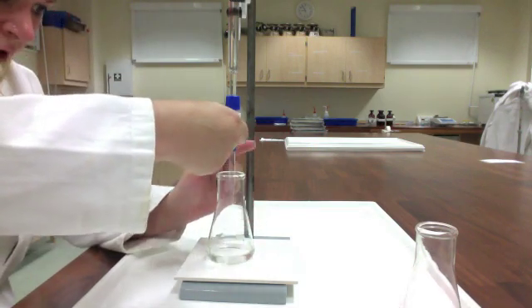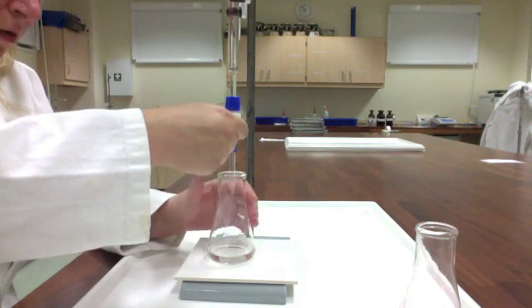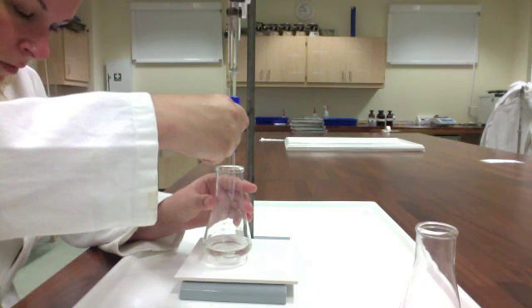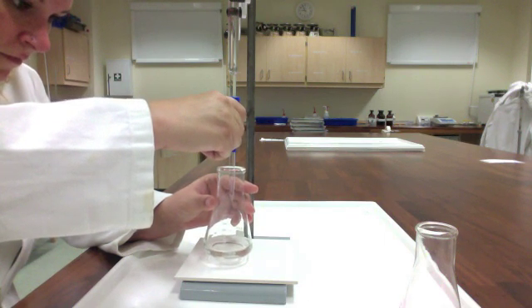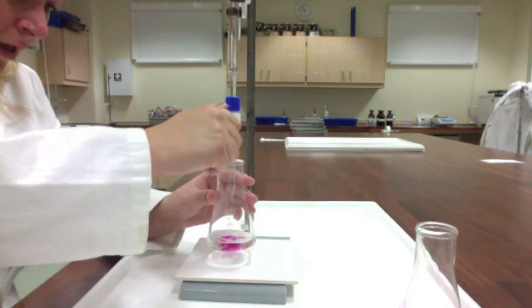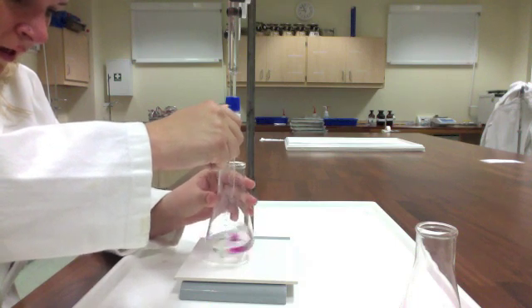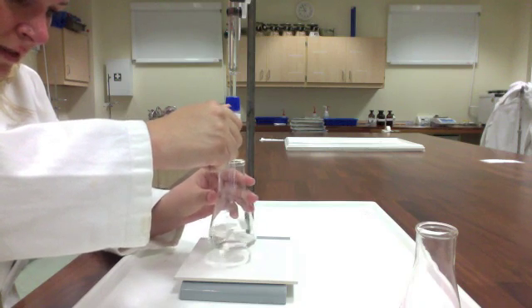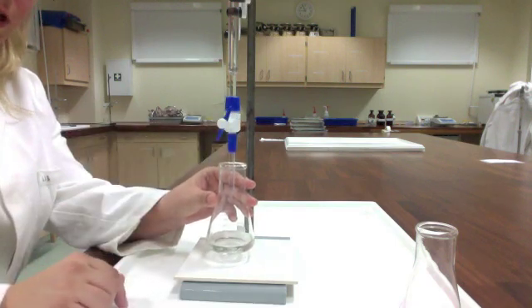And you'll notice how I don't actually even really care what the reading on the burette is until I'm done. So I'm just really focused on opening up this stopcock here. Do, do, do. Anytime now. So that I can add drop by drop. And so you see where drop by drop, other person slash my left hand is going to be swirling. You can kind of notice how much longer it's taking. So I can slow down that drop by drop delivery. And guys, here's where it's really important.